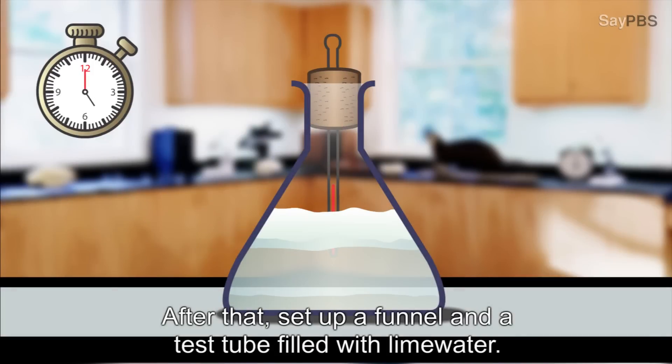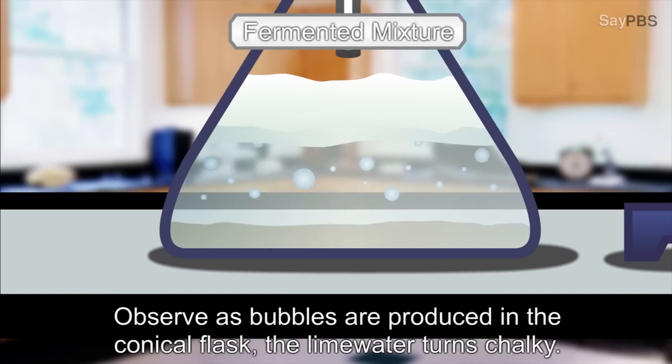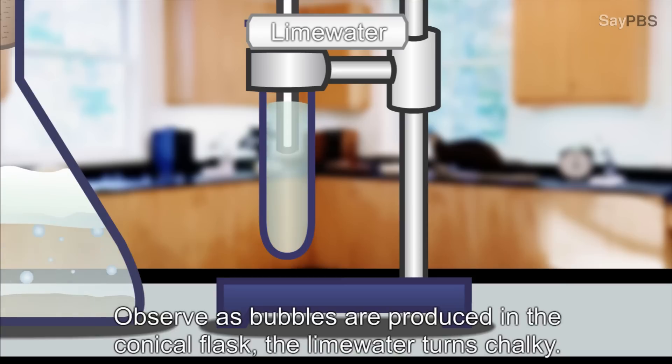After that, set up a funnel and a test tube filled with lime water. Observe as bubbles are produced in the conical flask, the lime water turns chalky.